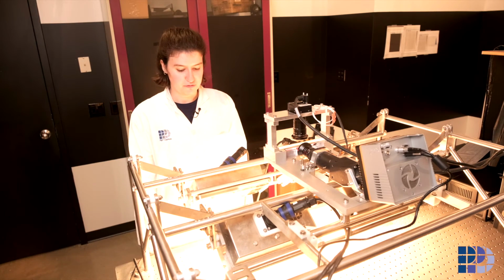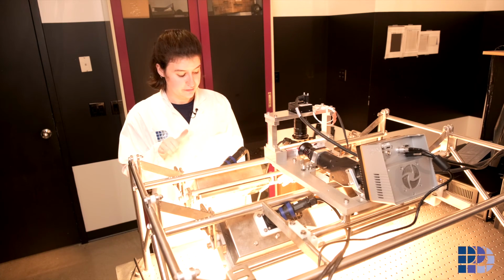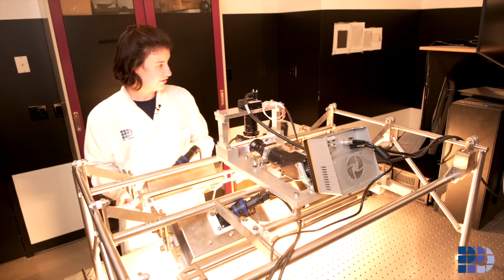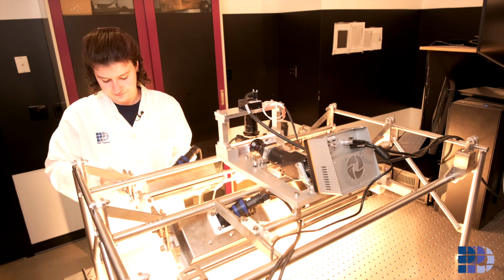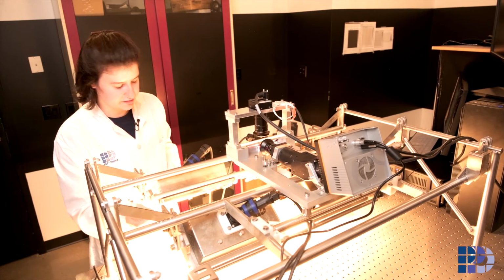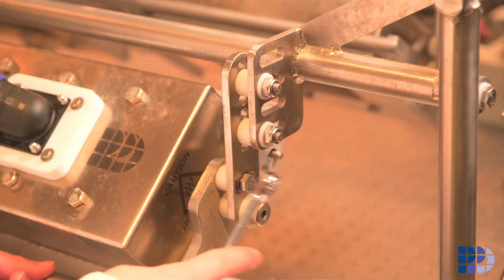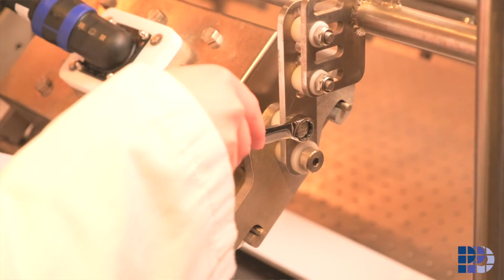The final check before we can confirm that the light profiles are good would be to run a calibration. So keeping an eye on the real-time display of the calibration profile, I would adjust both sets of lights until I'm satisfied with the calibration profile, fix them into place, and then run a calibration.